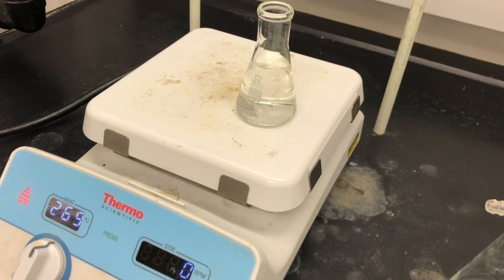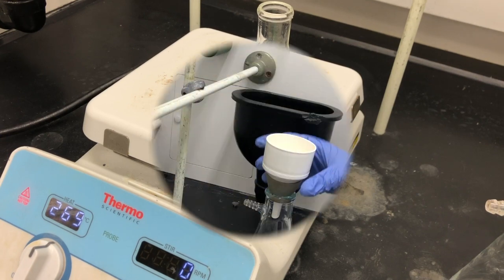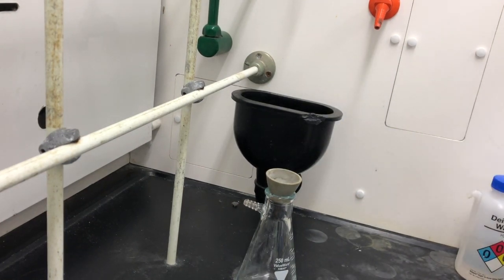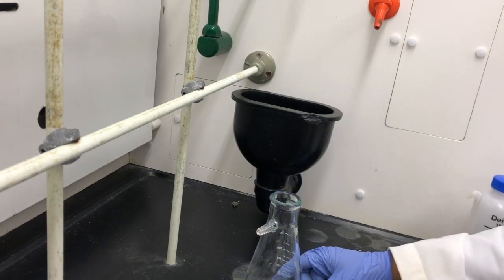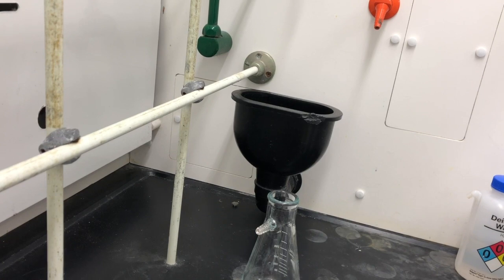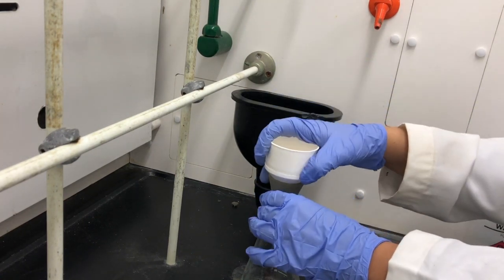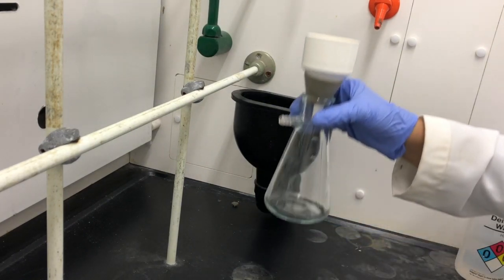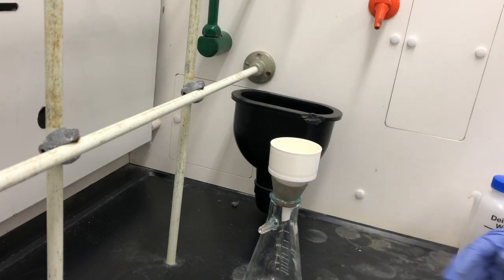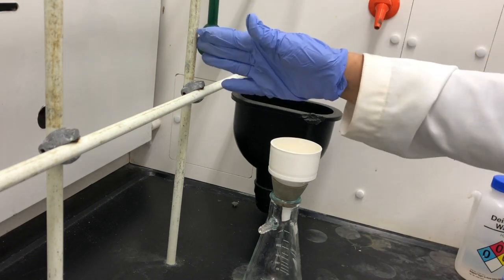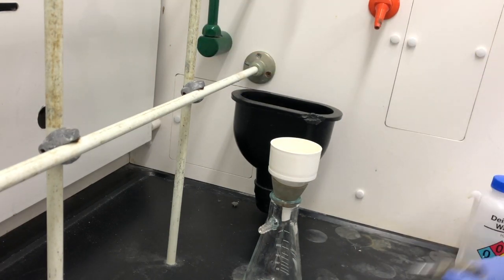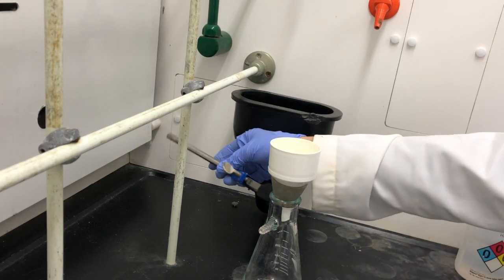So while we wait on the water to reach about 95 degrees Celsius, what we're going to do is set up the vacuum filtration. What we're going to be using is a sidearm flask. It has thicker glass to kind of take in the reduced pressure when we actually set up the suction filtration because we're going to attach it to a vacuum. We are going to use the Buchner funnel and we have to secure it on the actual flask. It's really important to secure our filter flask to the back support. We're going to use the clamp. We're going to set it at a height where it's going to hold it right in place.